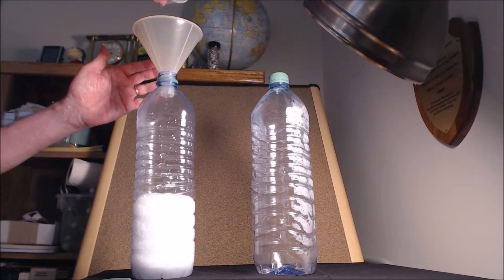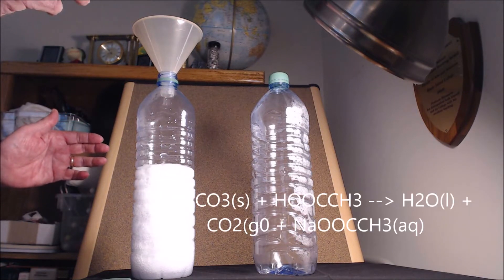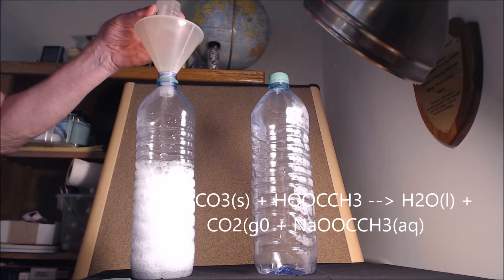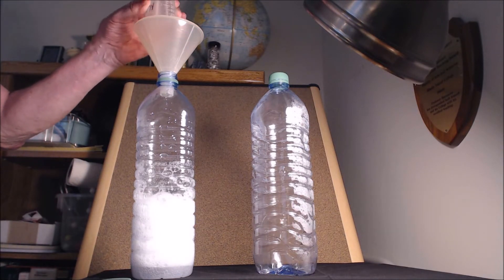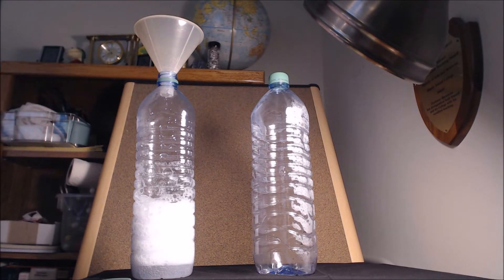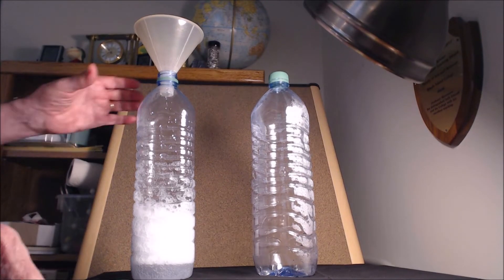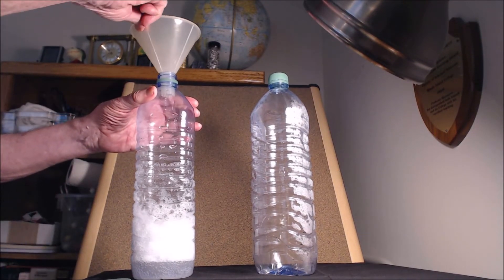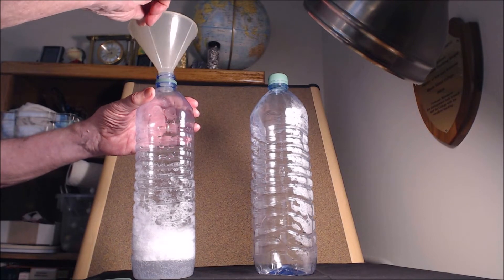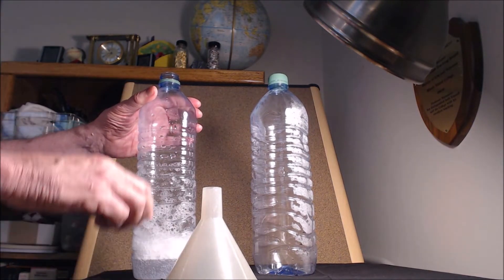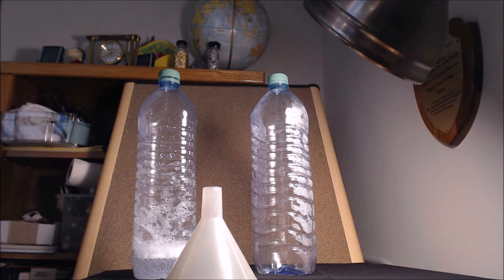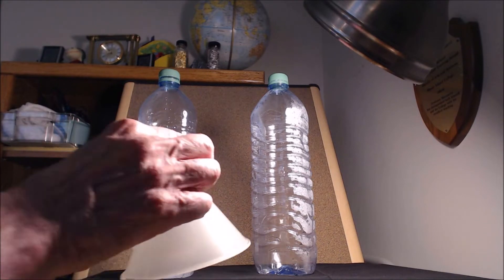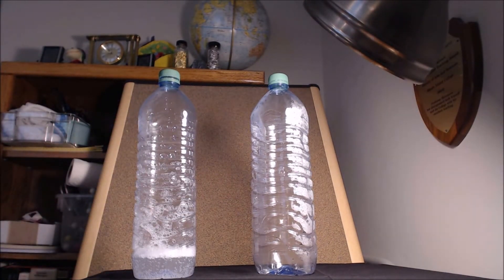I hope it doesn't overflow. It's a beautiful reaction and the bubbles of course are carbon dioxide when the carbonic acid is formed and decomposes. I'm going to cover it just slightly. I should have enough in there to fill the bottle with carbon dioxide.